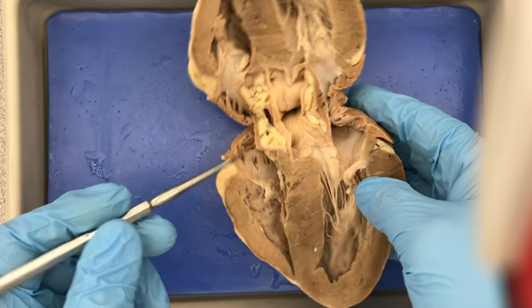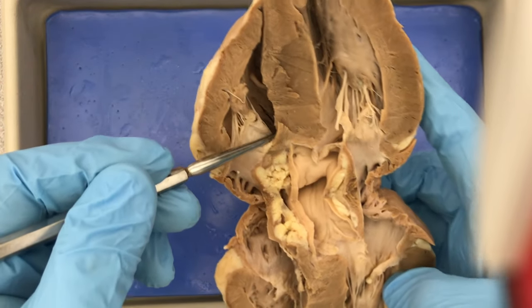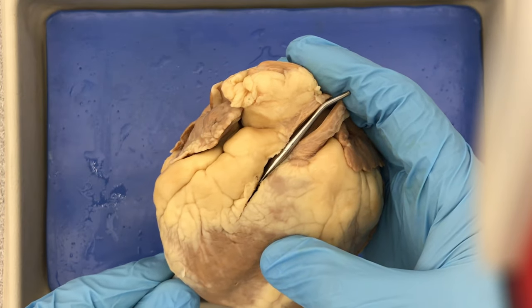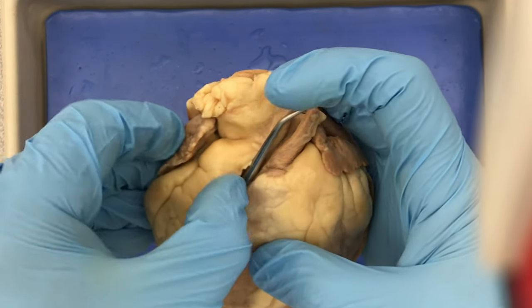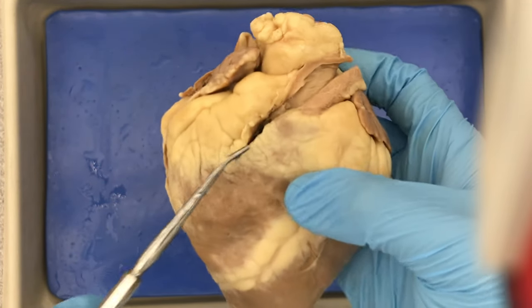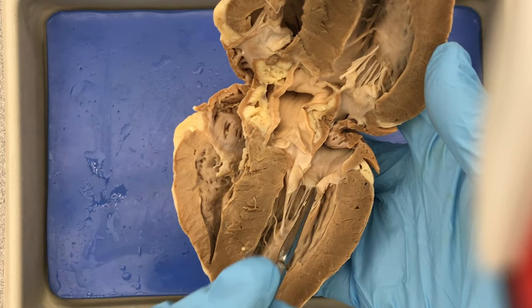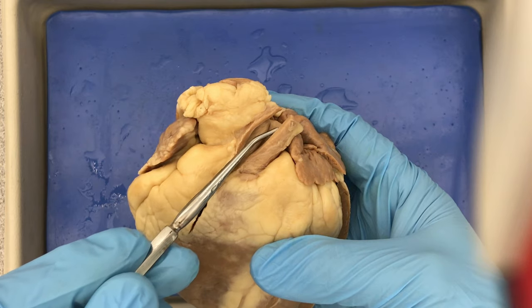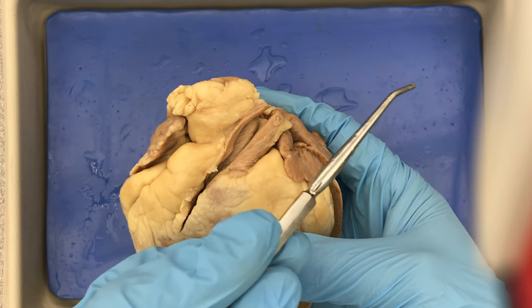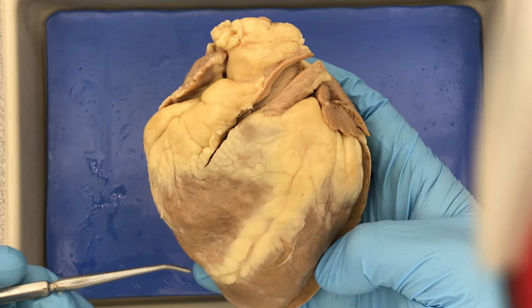Blood flows from the right ventricle up and across. If you take a probe and insert it, it will come out of the pulmonary trunk, meaning it has passed through the pulmonary valve. The blood then exits through the left and right pulmonary arteries, goes to the lungs, and comes back through the left and right pulmonary veins, now oxygenated.